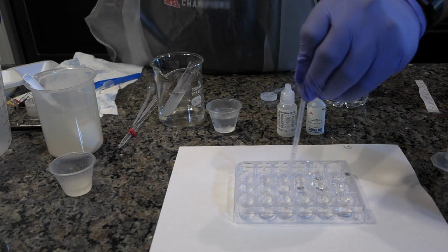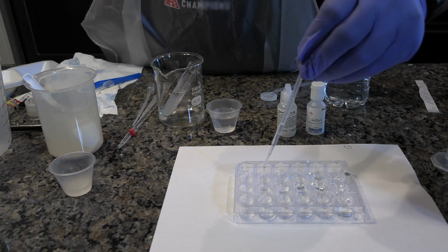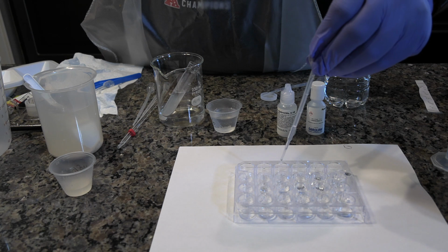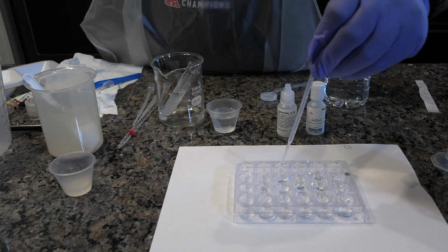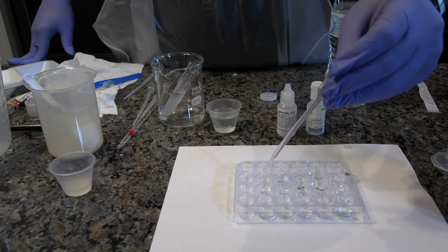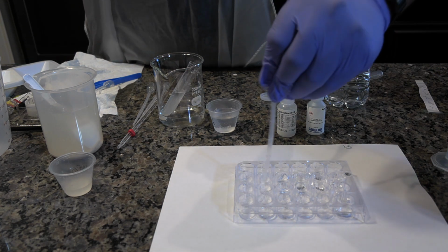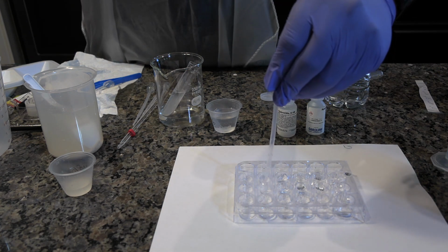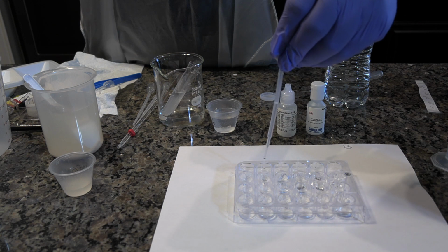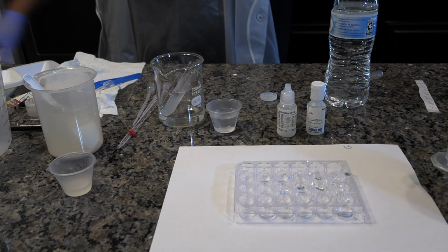Using the pipette labeled base, dispense 2 drops of the solution from well C4 into well C5 and 10 drops into well D4. Using the water pipette, dispense 18 drops of water into well C5. Rinse each pipette. Using the pipette labeled base, dispense 10 drops of solution from well C5 into well D5.